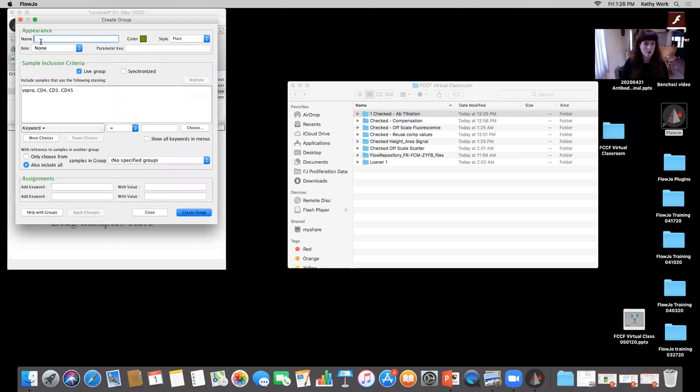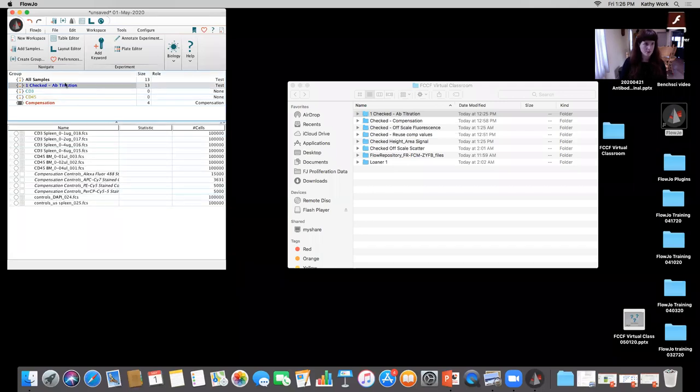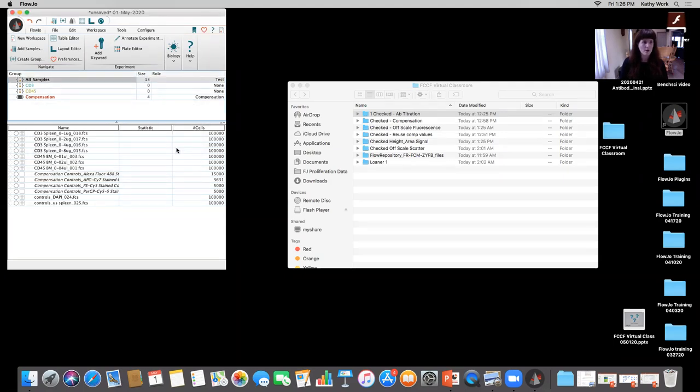Okay. And then I'm going to create a group for CD45, okay? Because those are the two antibodies from this titration set. When I come either to the folder, the group that was named after the folder, all samples, it has the same samples, so I'm just going to delete that one. And then I'm going to drag in the CD3 spleen into that CD3 group.